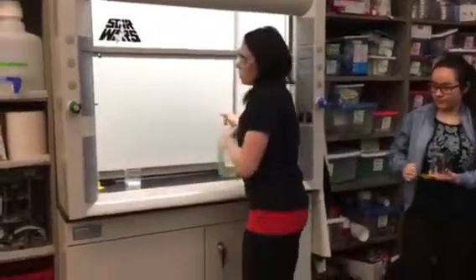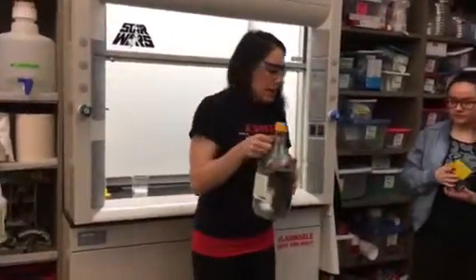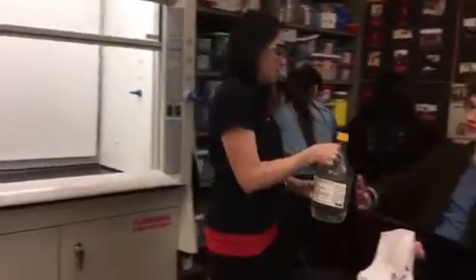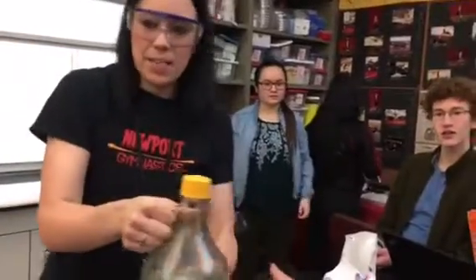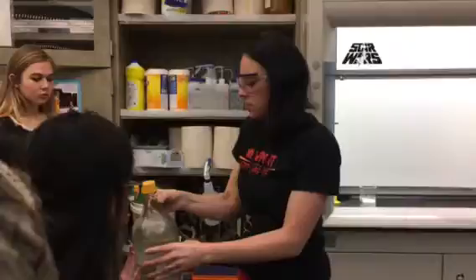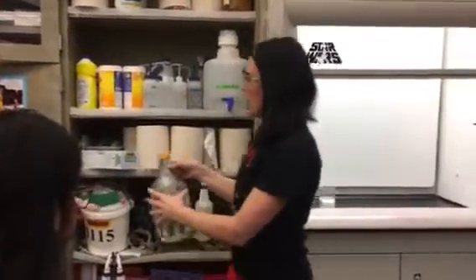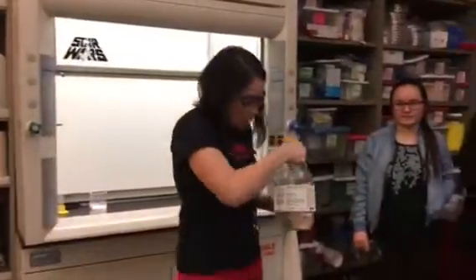Then I'm going to pour some sulfuric acid into it. I'm going to measure it first, but I want someone to feel the outside of the bottle. How does it feel? Sticky. Really sticky. It's not because I got something on it — the store sells it to me sticky on purpose. Why? So I don't drop it.